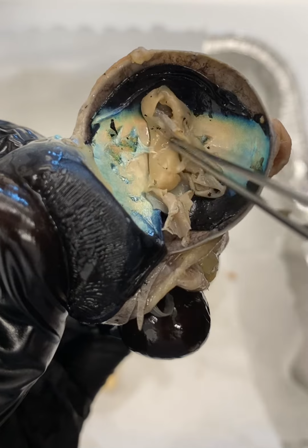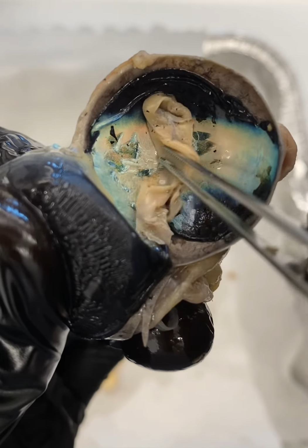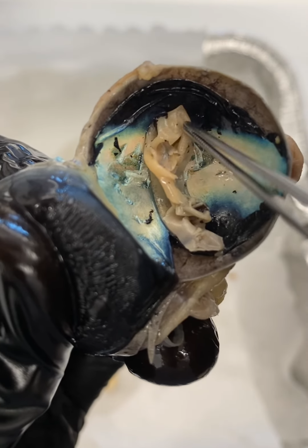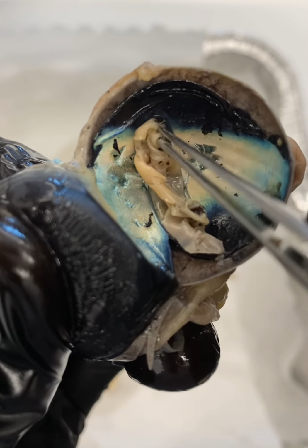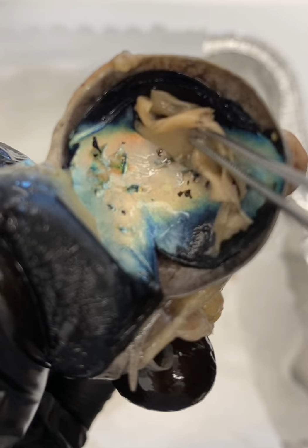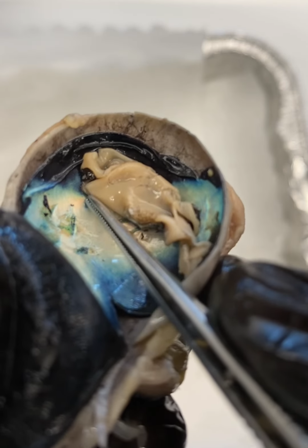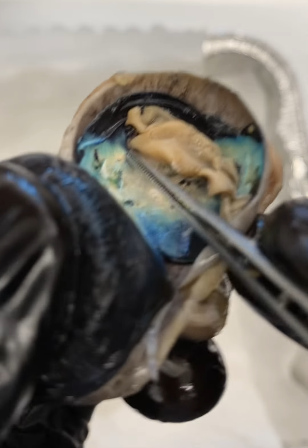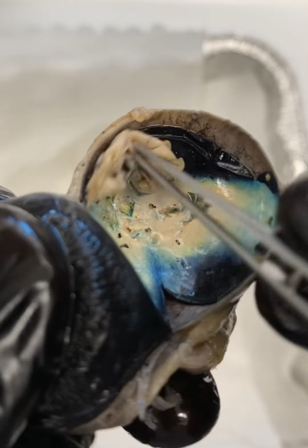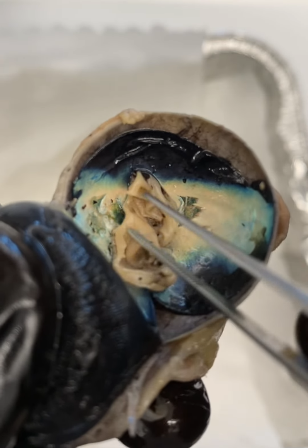If we continue peeling the retina, all this, notice it's anchored there at the optic disc. We can't move it beyond that optic disc, because that's where the retina is leaving. We can move this all around, and you'll notice it's pivoting around that one point right back here at the tip of my probe. That's the optic disc. We can continue moving this, and it just stays attached at that one point.